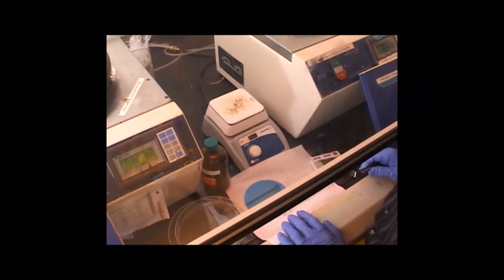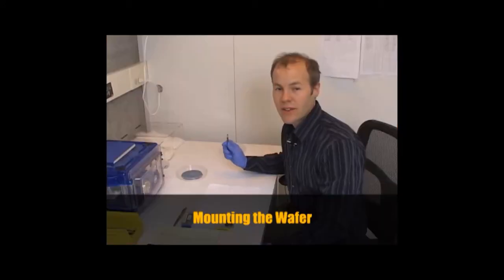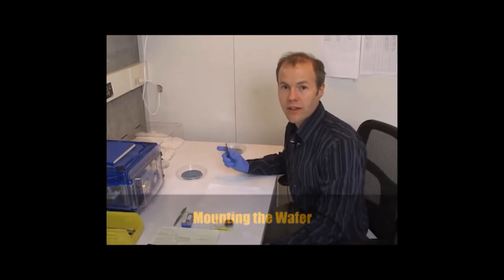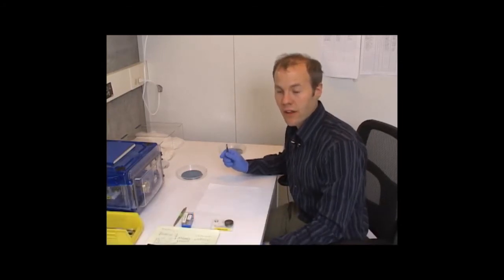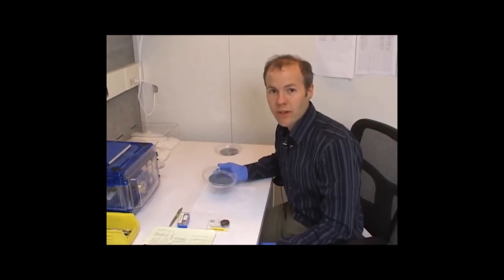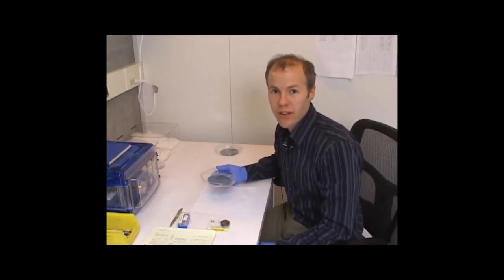Let it cool. And then before we pattern the surface, we'll break this into smaller pieces. The chamber size on our system is limited to about 5 centimeters in the X and the Y direction, so we can't write on this entire wafer. So the next thing I'm going to do is break it into smaller pieces so that it fits into our system.